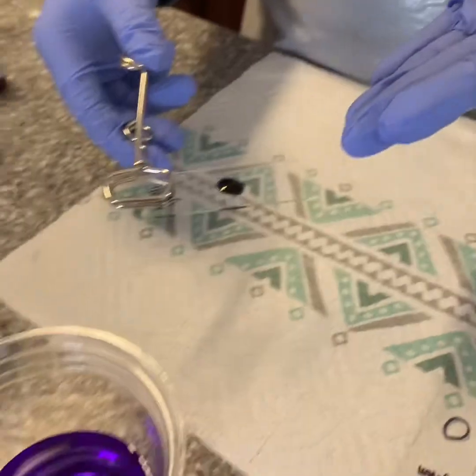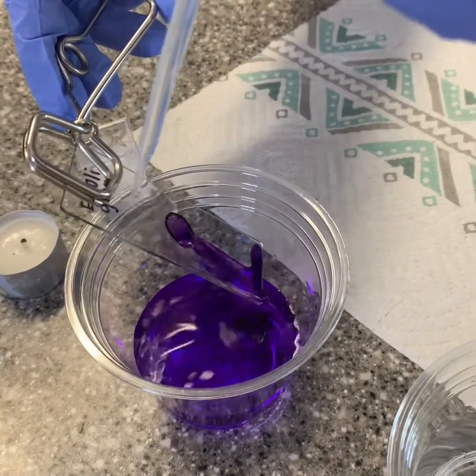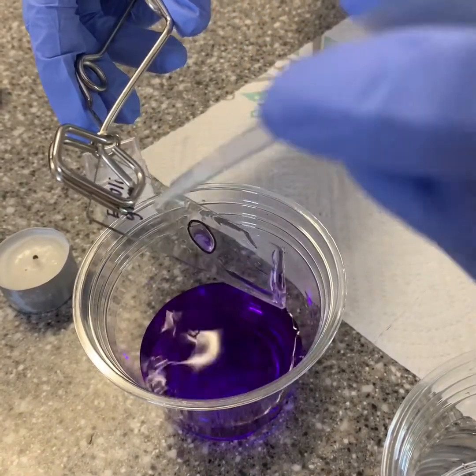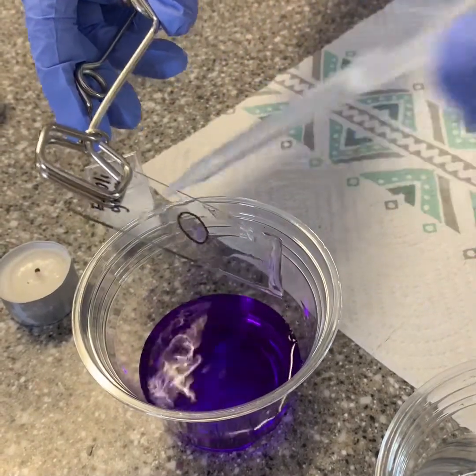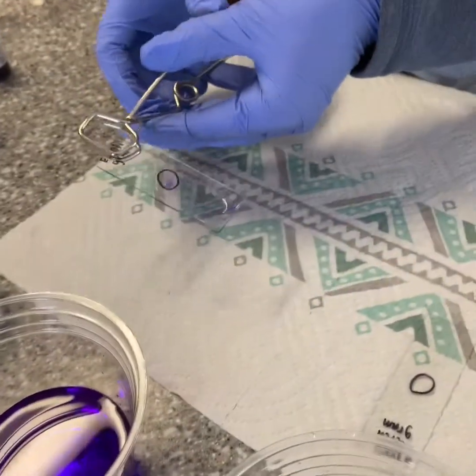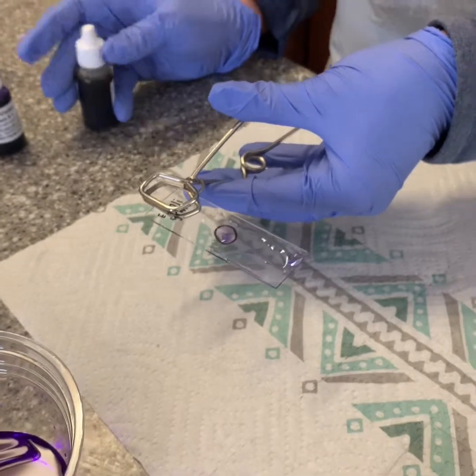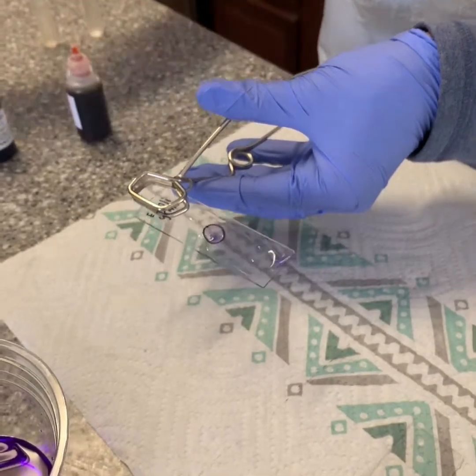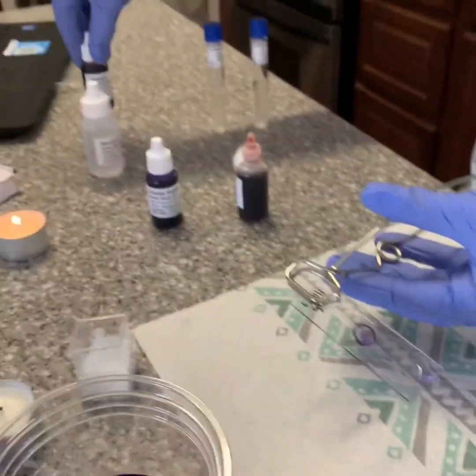This has been on the slide for 60 seconds and I'm going to be washing it off gently, and not right over the bacteria. I have heat fixed this onto the slide and now I'm rinsing the crystal violet off. Now I'm going to be placing my iodine on the slide and I'm going to be rinsing that off after 60 seconds, then continuing on with the same process of putting the dye on, letting it sit, and then rinsing off with my decolorizer and my safranin.